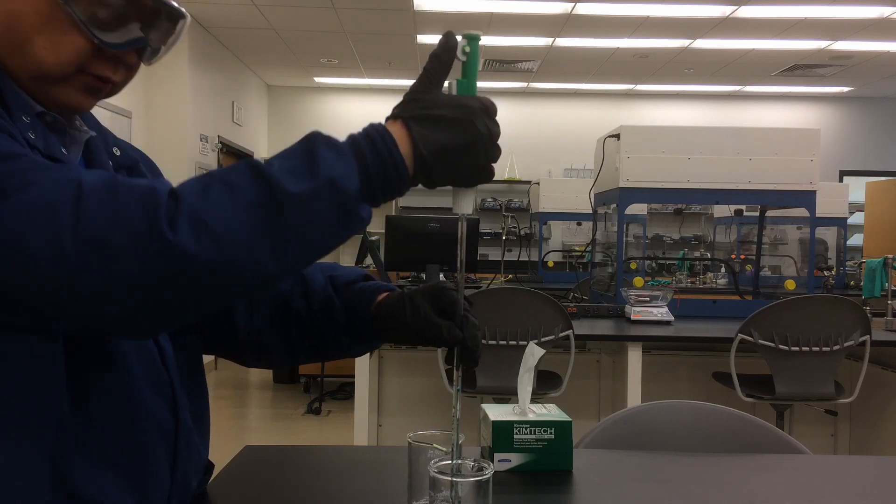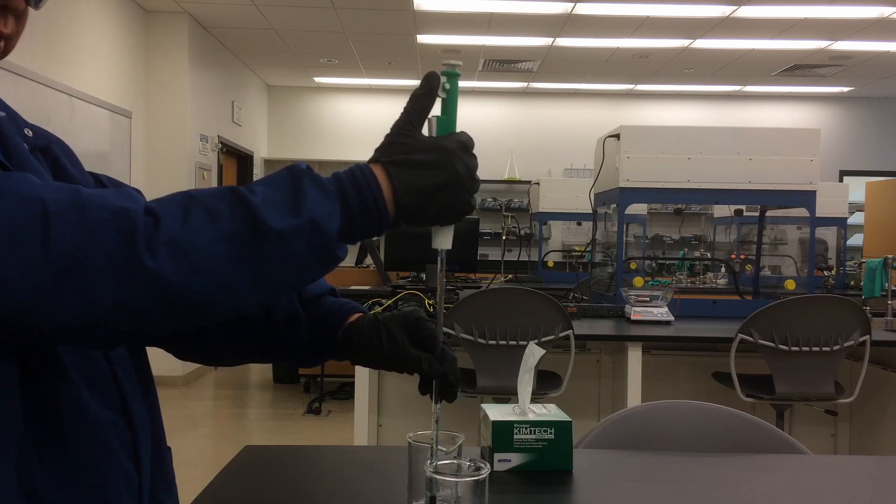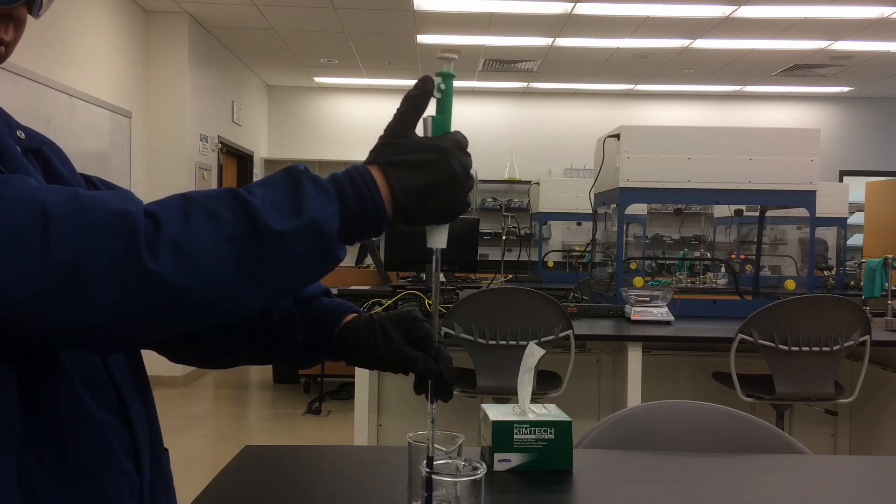Second, fill the pipette. Roll down the wheel to draw the solution until a few centimeters above the zero mark.